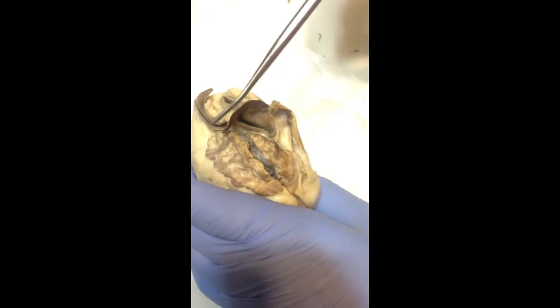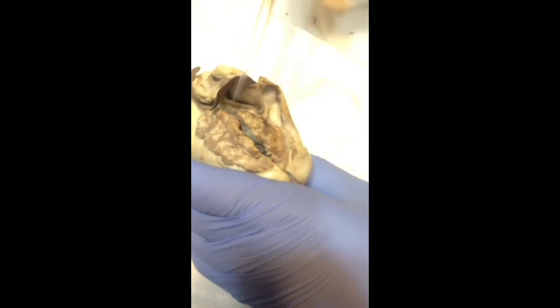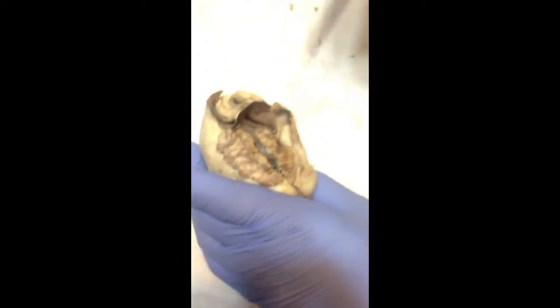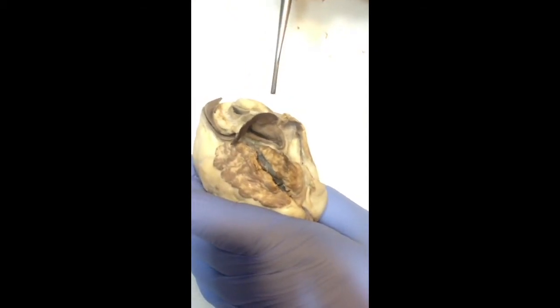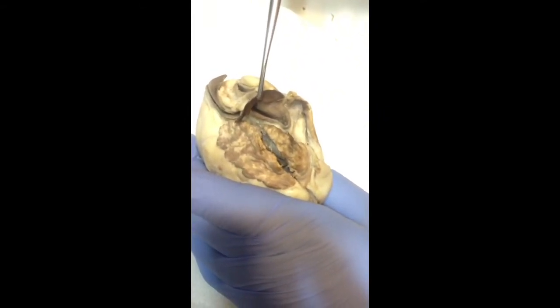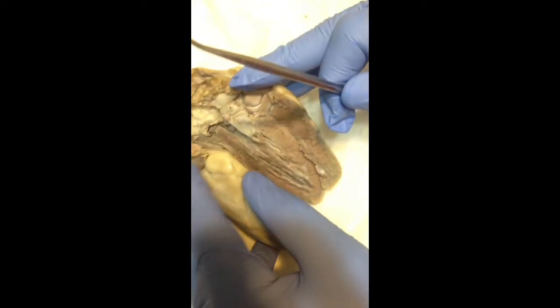And then we have the brachiocephalic artery. Here it is being cut off also, but it's supposed to be around here. And so are the left common carotid and the left subclavian. They are all up here in this place. Okay, right.